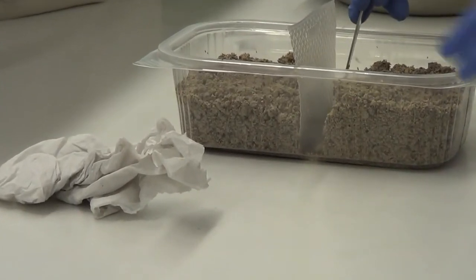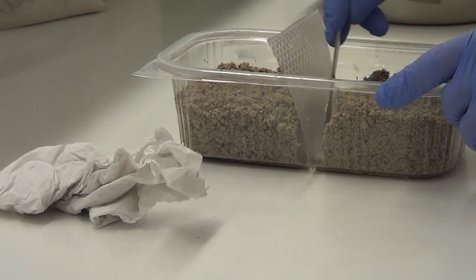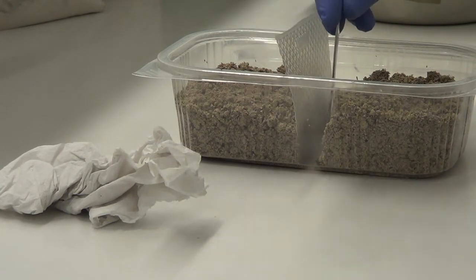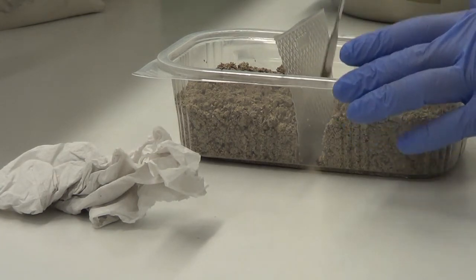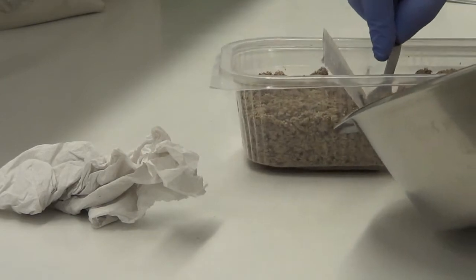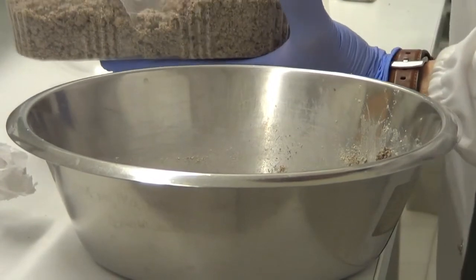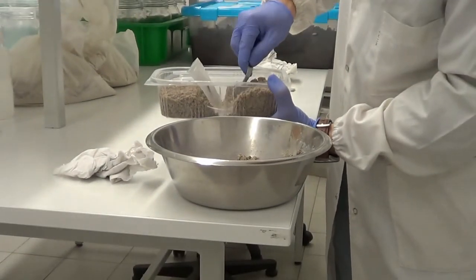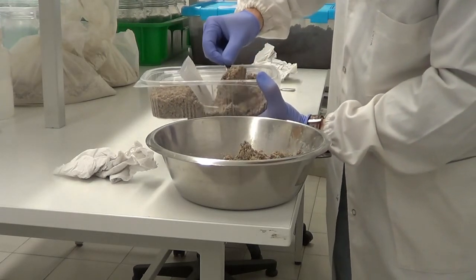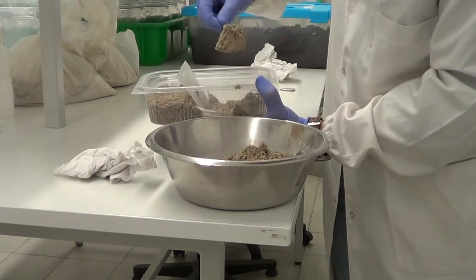The divider should be inserted to avoid the movement of the organisms to one side or the other. If we find an earthworm in the middle, that earthworm should count half on each side of the replicate. Then we should remove one of the sections to the tray in order to take all the earthworms of this side to the tray, and the number of organisms will be counted.